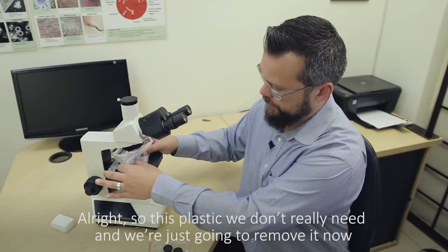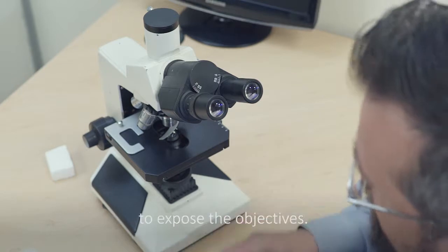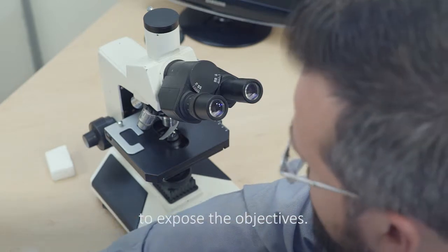So this plastic we don't really need and we're going to just remove it now to expose the objectives.